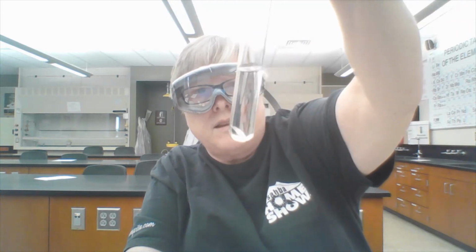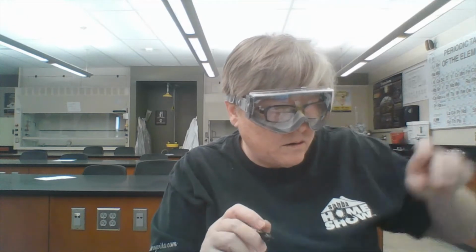So I would say that there's no reaction between magnesium sulfate and zinc. And it looks like I skipped a reaction. I'll have to go back and do it again.